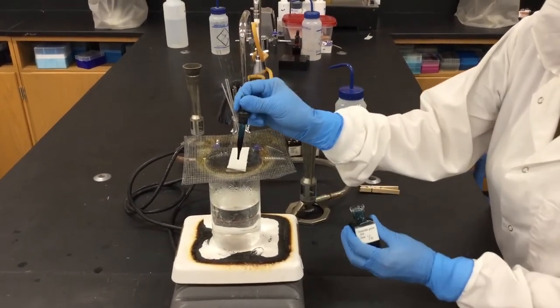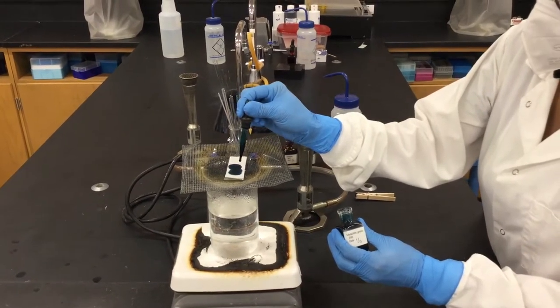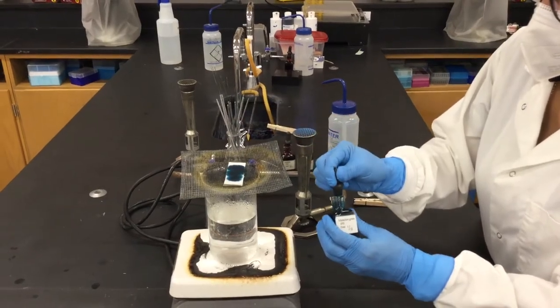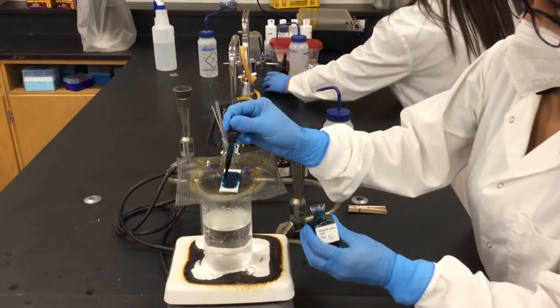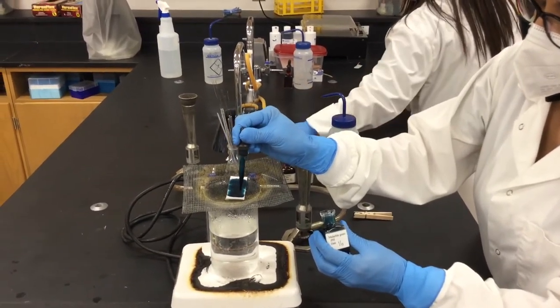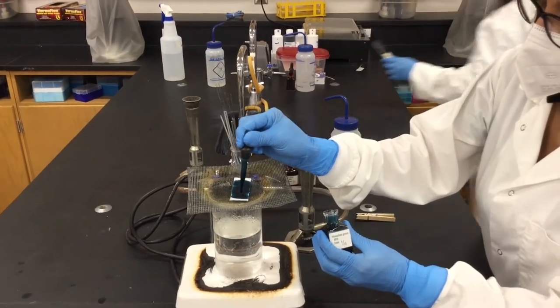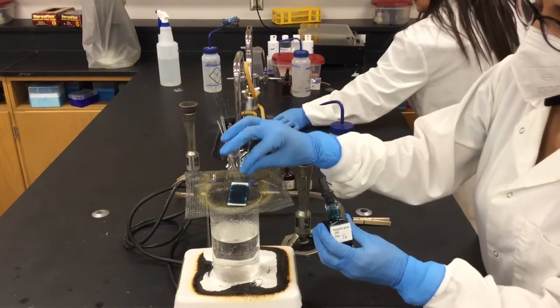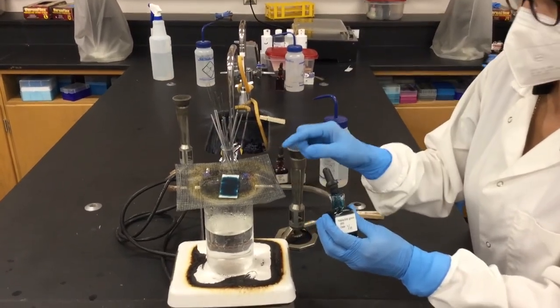So you will be covering your glass slide with the paper towel with malachite green, which is the stain that stains the spores in bacteria that produce endospores. So this is going to be a staining that you will have to wait a little bit, so you will add this dye onto the top until you have it all flooded, and then you will wait for five minutes.